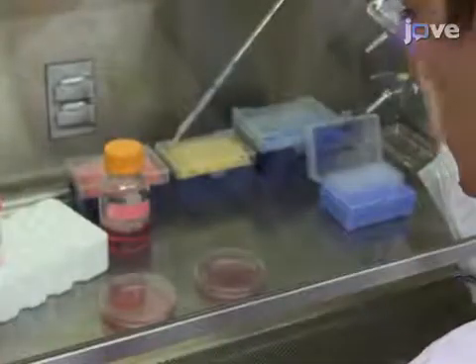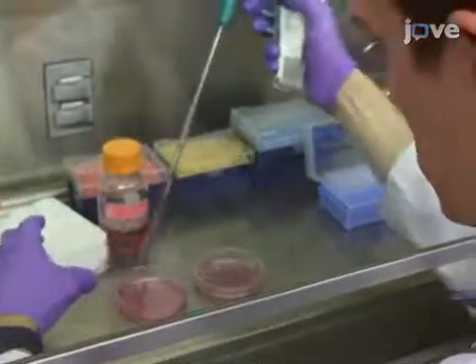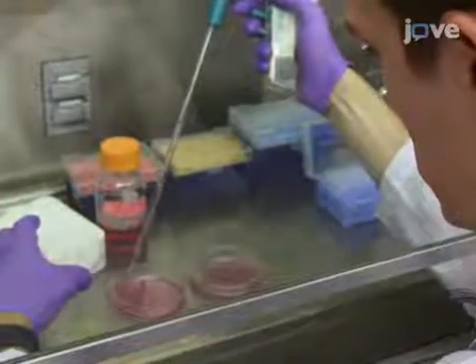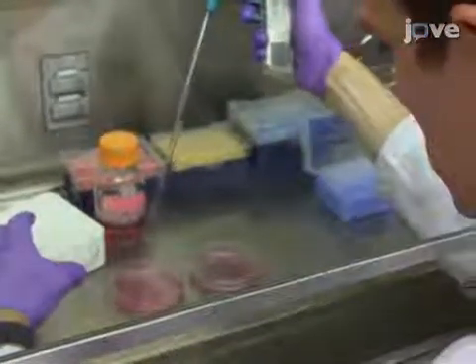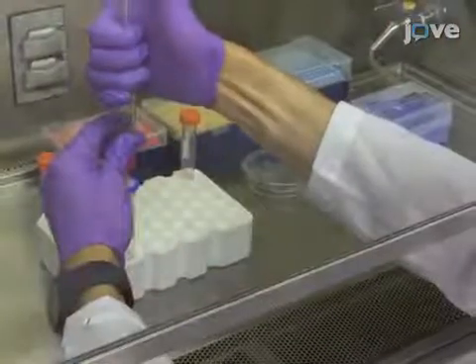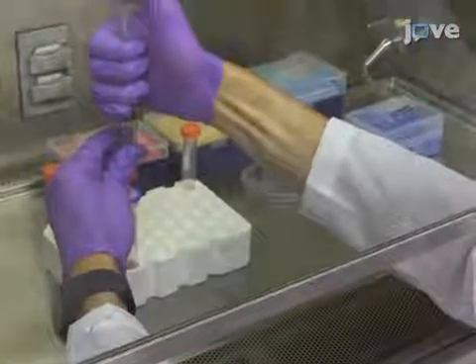Co-transfect the DAMID vector with the lentiviral packaging plasmids following the forward transfection procedure according to the manufacturer's protocol. Be sure to include a filtration step using a 0.45-micron PVDF filter.